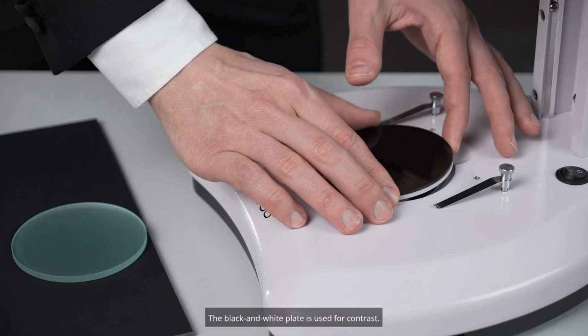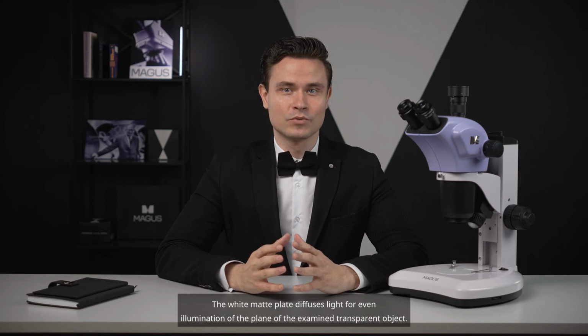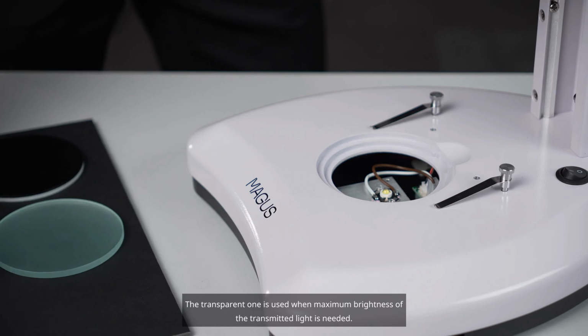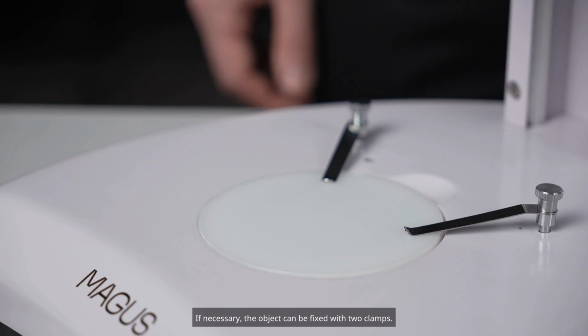The black and white plate is used for contrast. Light objects are examined on a black background, while dark objects are examined on a white background. The white matte plate diffuses light for even illumination of the plane of the examined transparent object. The transparent one is used when maximum brightness of the transmitted light is needed. If necessary, the object can be fixed with 2 clamps.